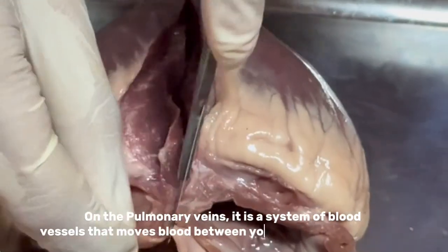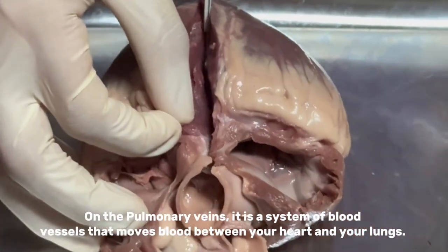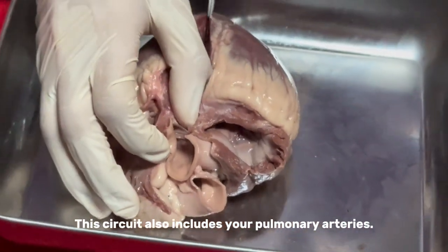The pulmonary veins are part of a system of blood vessels that moves blood between your heart and your lungs. This circuit also includes your pulmonary arteries.